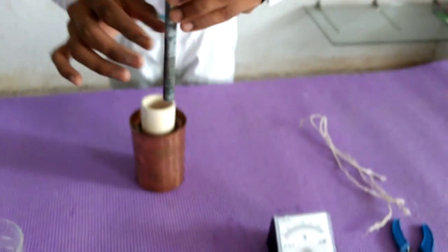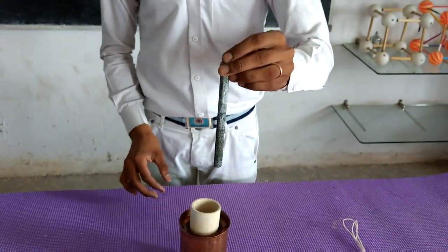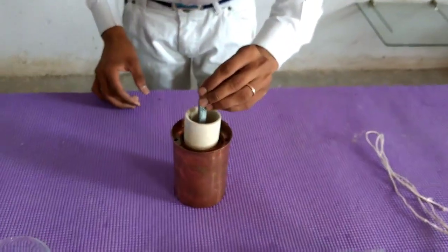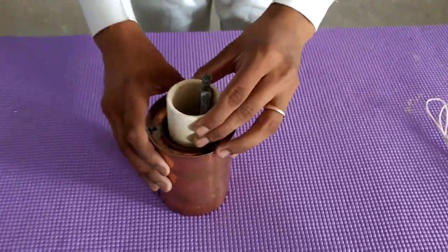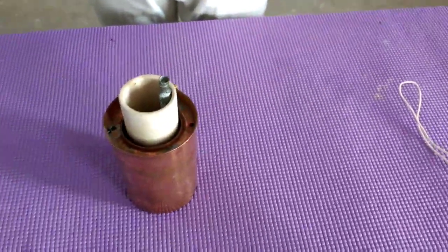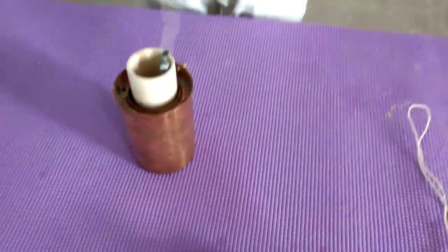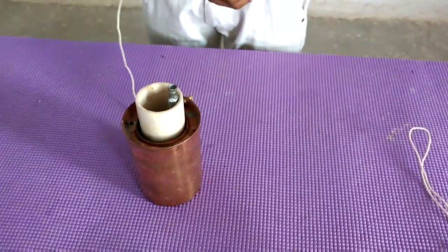A zinc rod is dipped into the zinc sulfate solution. This zinc rod will work as the negative plate where oxidation will take place, and it is rich in electrons.